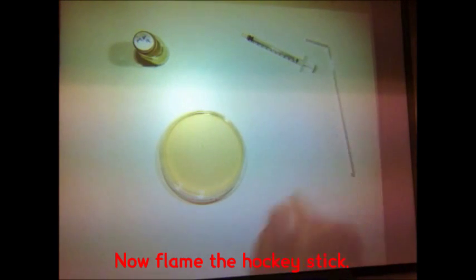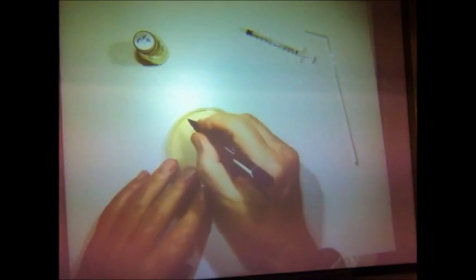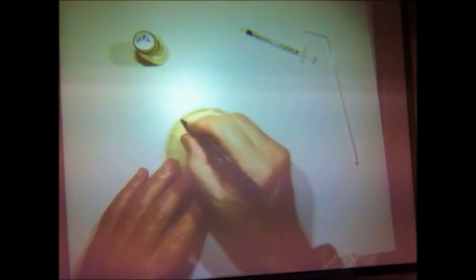Finish off by sterilizing your glass rod in the flame, and that's how you can do a spread plate.